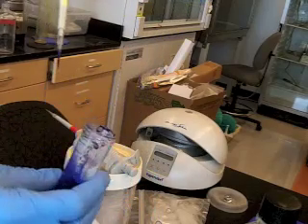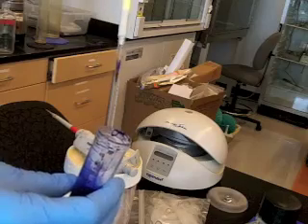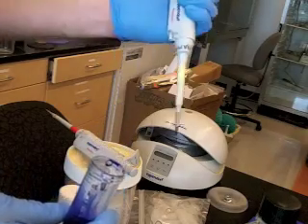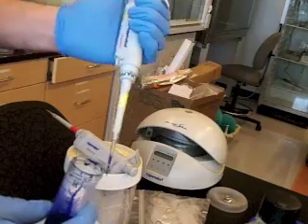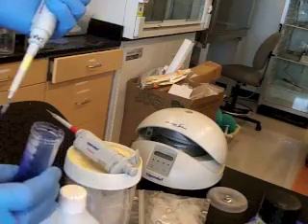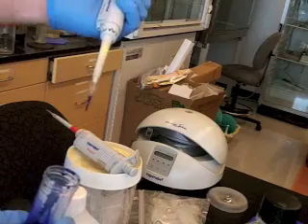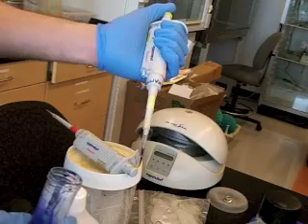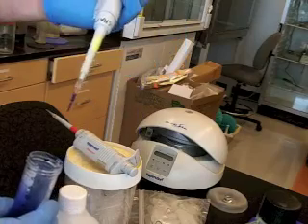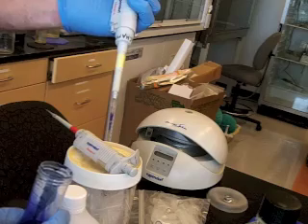The next rule for good pipetting is that when we're micropipetting, we often are micropipetting multiple volumes into a target tube. So a little of this, a little of that. And what we want to do is we'd like to pipette in a first volume that's a big volume, and then pipette smaller volumes into the big volume.